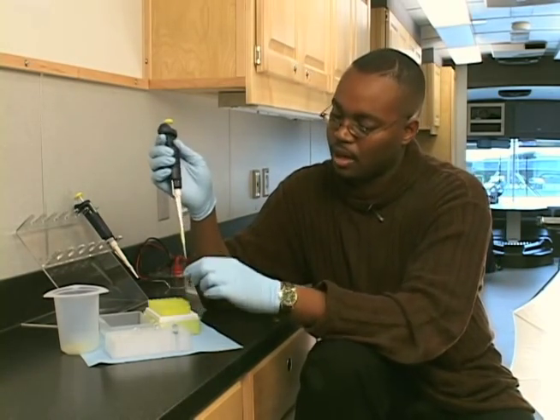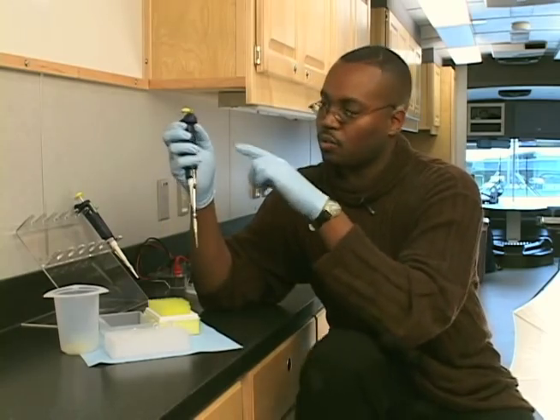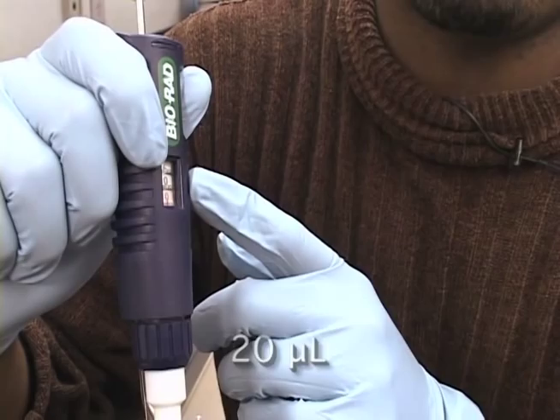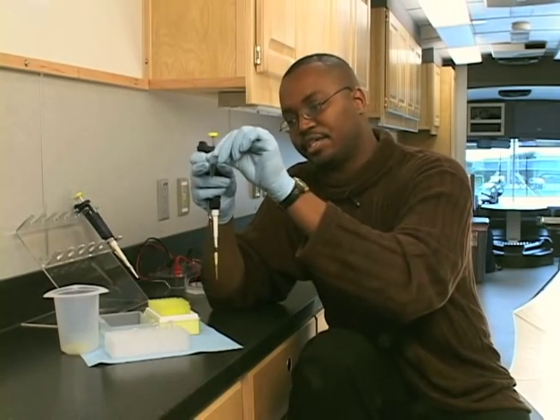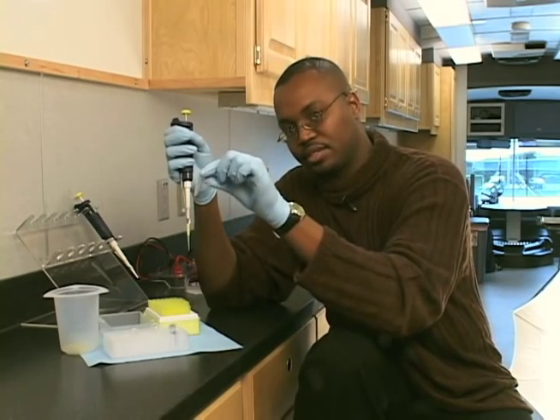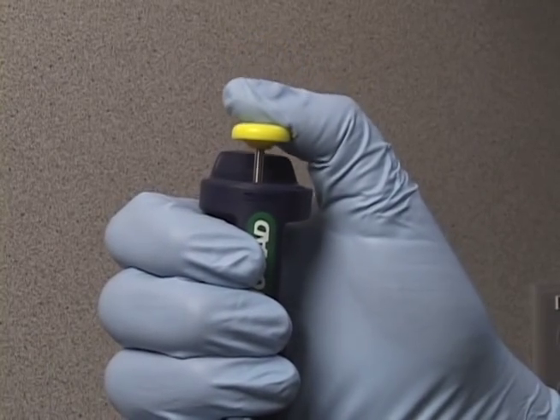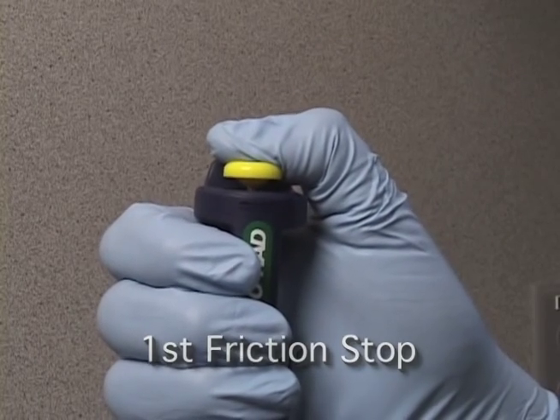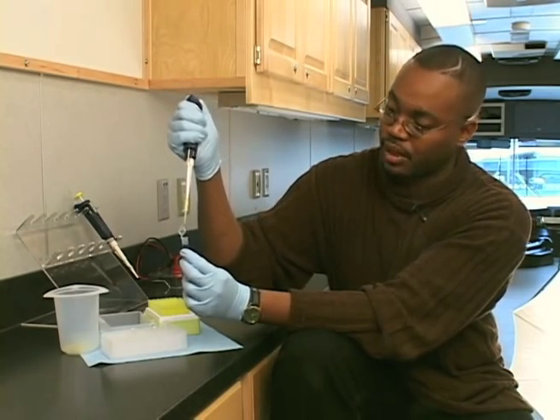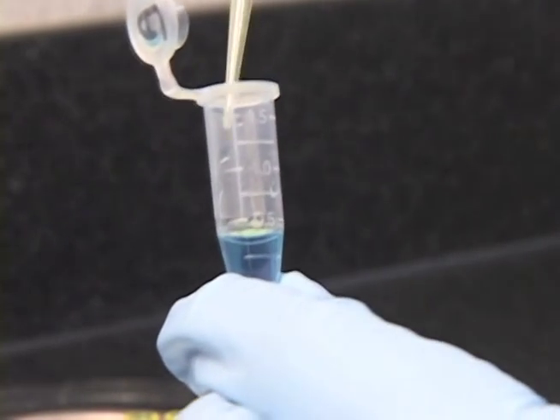What I'm going to do is I want to take 20 microliters. This pipette is set for 20 microliters. I want to take 20 microliters of volume from this blue colored liquid and put it into this empty tube. We're going to push down on the plunger to the first friction stop. I'm now going to put my pipette tip into the blue liquid, under the surface.